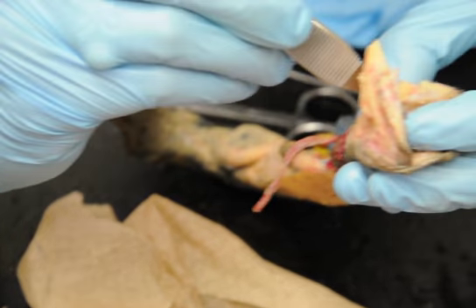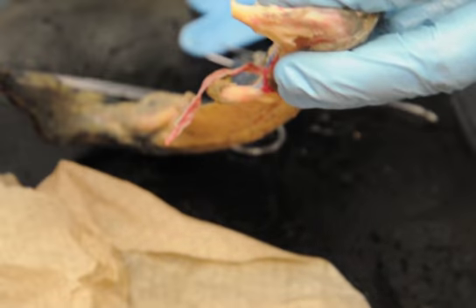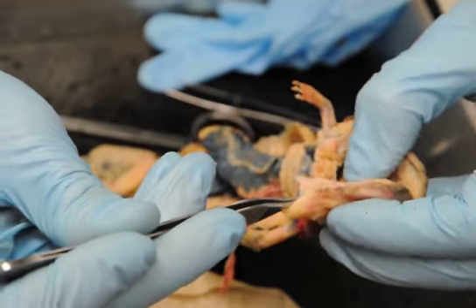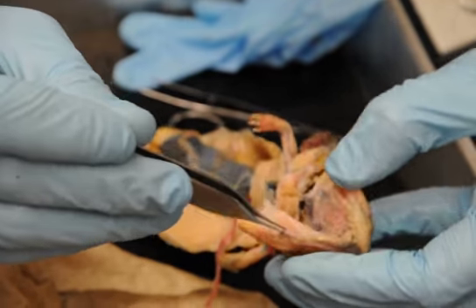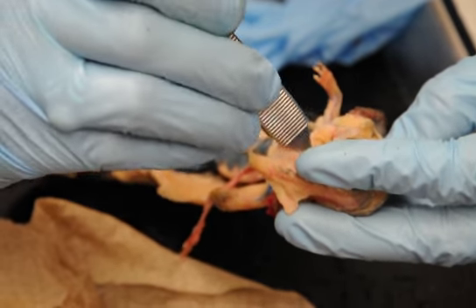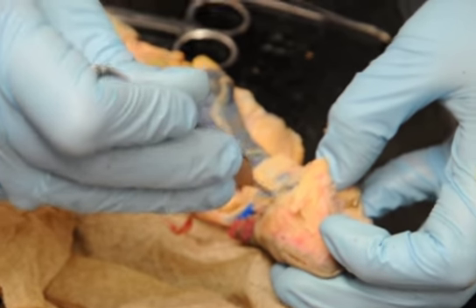It looks exactly like it does in the shark, where it comes up and it goes left and right. Radix, except it's a little bit bigger proportionally in the mud puppy, and this one doesn't show it. Yours does really well. And then sometimes the external carotid will be up here, but you know. I also have one of those. So you should look at Robin's mud puppy for all of that, because this one doesn't show it very well. And the heart's a little kind of exploded too.